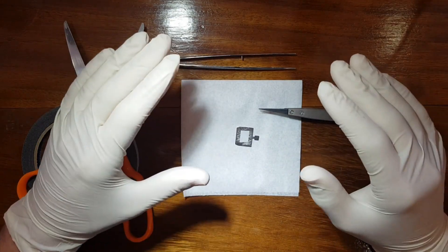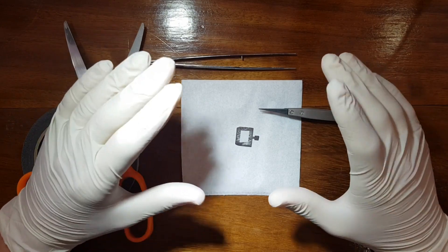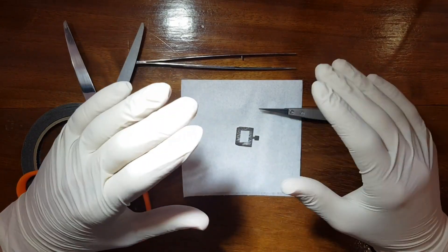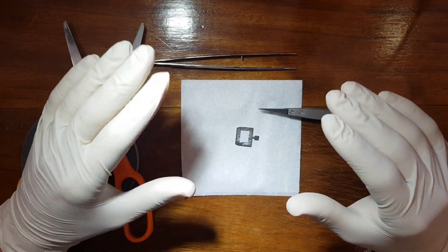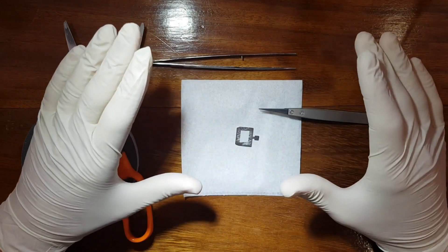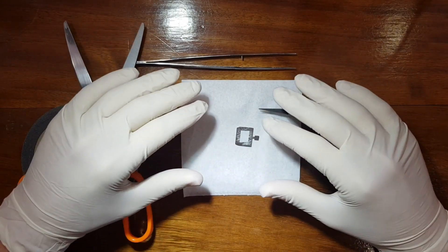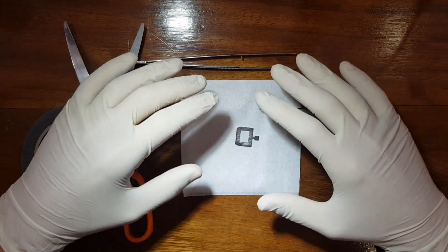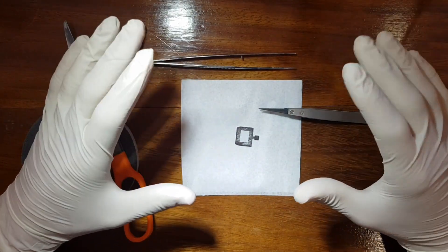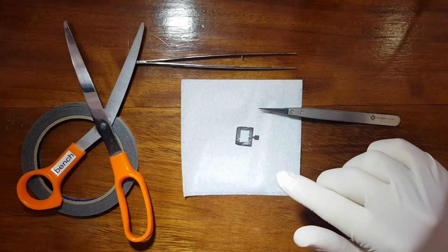Now a tiny bit, it's not going to kill you, it's not the end of the world because it will degas. It will hurt the vacuum slightly but if it's a tiny bit it's fine. Obviously if you start touching this with your bare hands, things are going to get problematic.